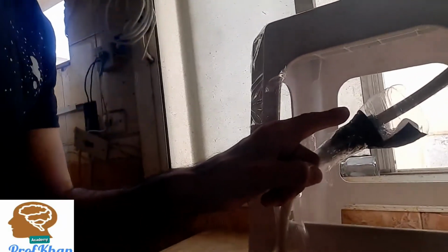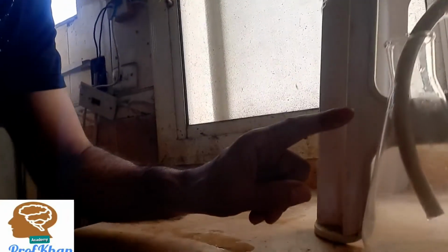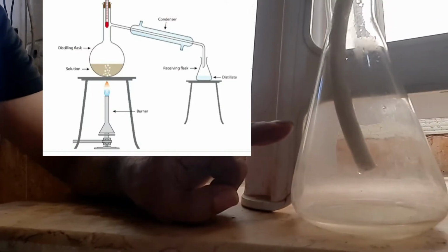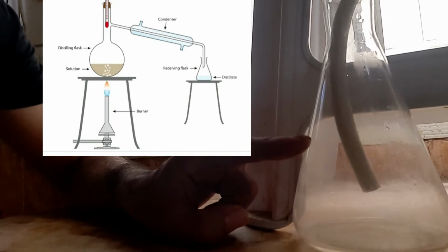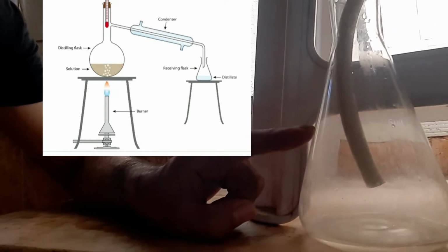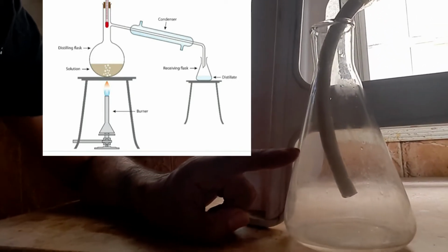There is also another condenser to make it cooler, and ultimately into that flask you can find the drops falling down. This is the water we want to get, because it is basically the steam which is produced, cooled down by condensation and then dropped down here. So we are going to wait for some time.